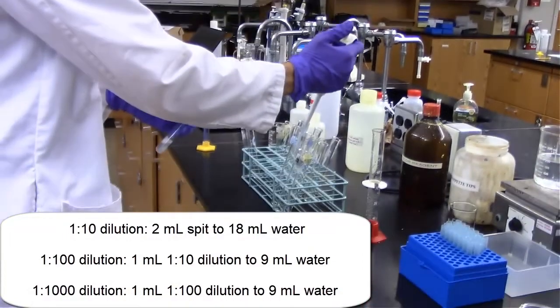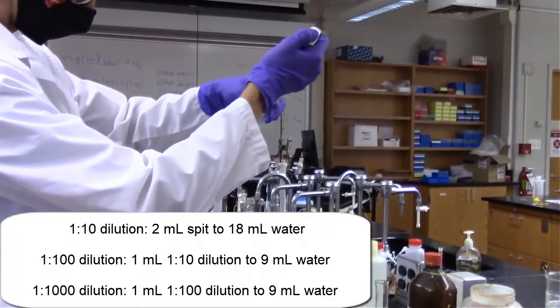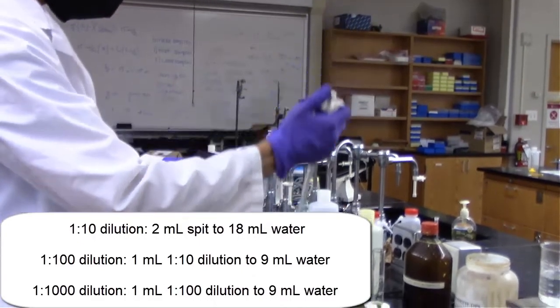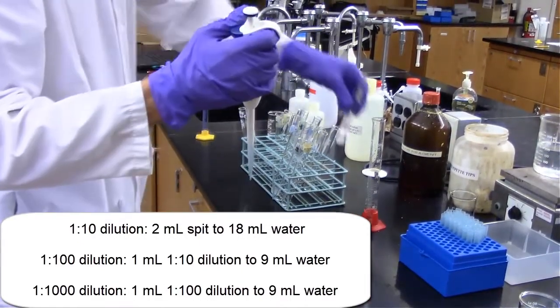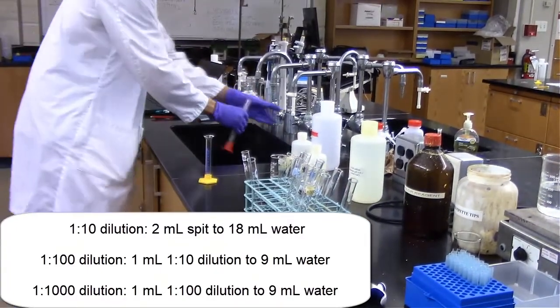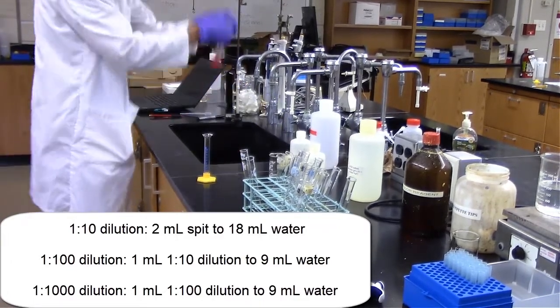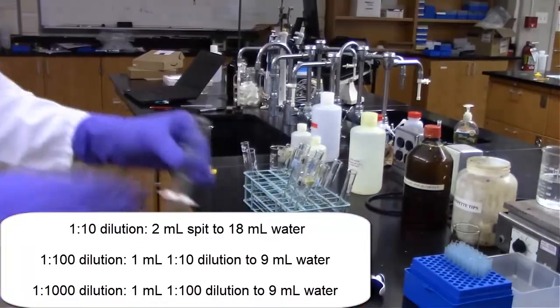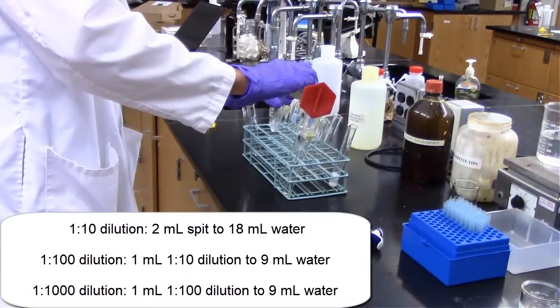Right, for this next part of the experiment, we are preparing different dilutions of my spit. So I spit in that test tube, and from the water of the spit, I'm adding 2 milliliters into a test tube and 18 milliliters of water. So right now I'm getting 18 milliliters of water. It's referred to as a 1 to 10 dilution. So it is 1 part of the reagent and 10 parts total. So if we divide those both by 2, it's 1 to 9.